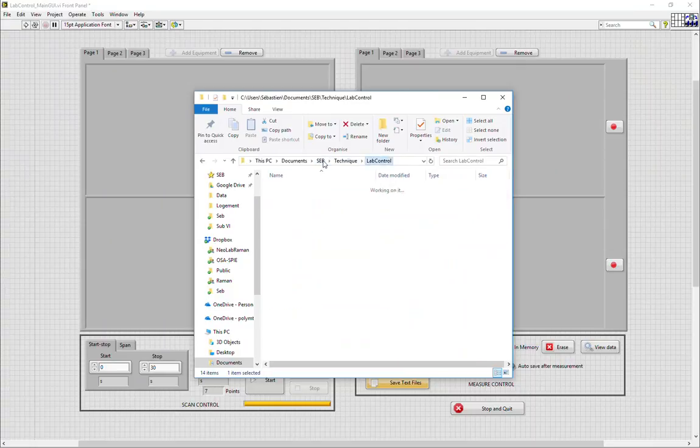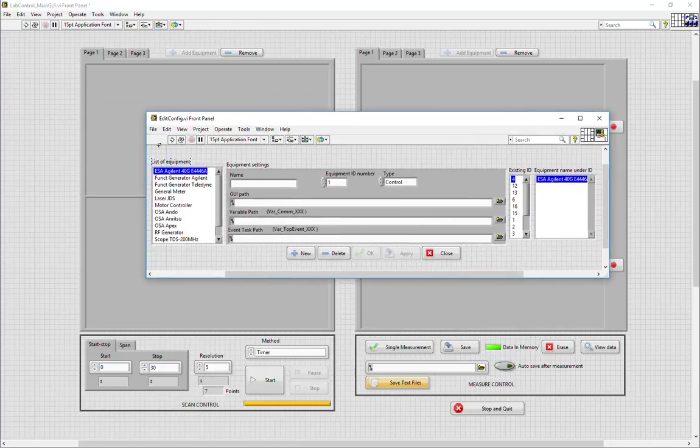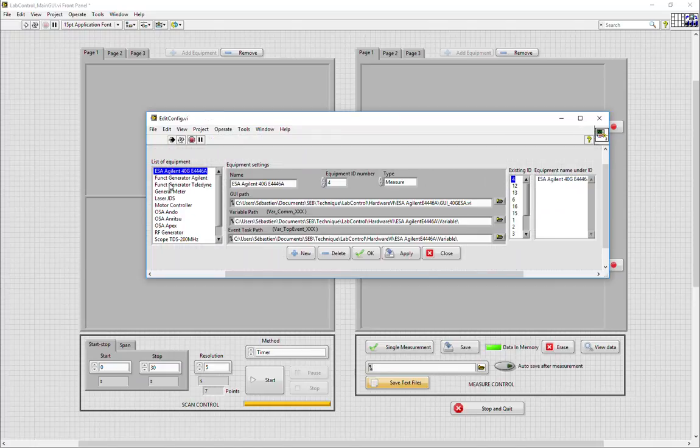Now the hardware can be selected through the edit config VI. It is recommended to run the edit config VI to read the config file, and all the available equipment that are currently set in the config file will be listed. Each equipment has a name and an equipment ID number, which is used by the system to make sure that you have different equipments. And here is the type of equipment, whether it is meant for measure, control, or both. This will define whether it can be set on the left control panels or on the right measurement panels.